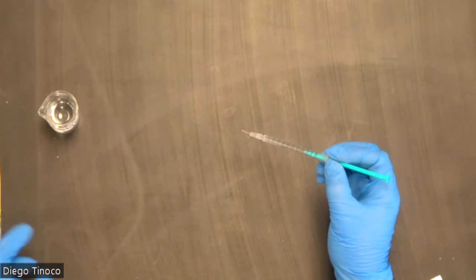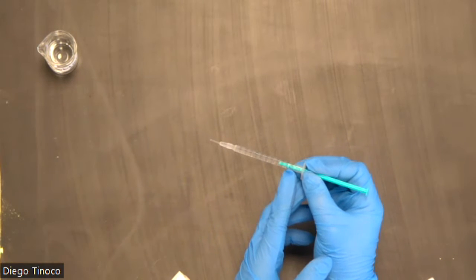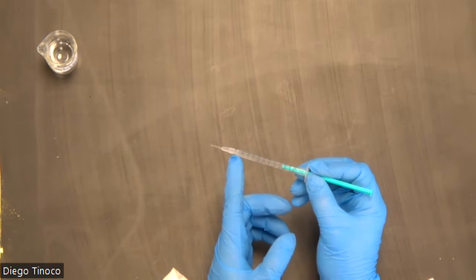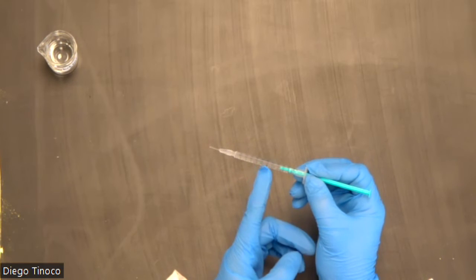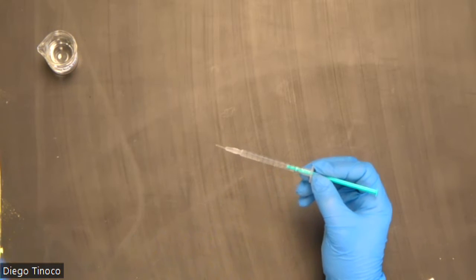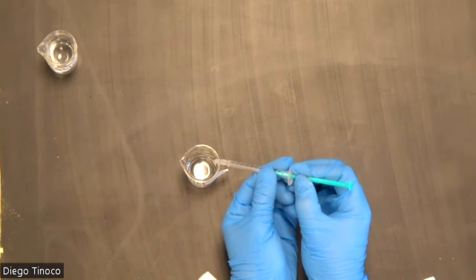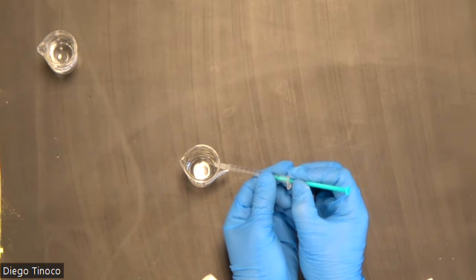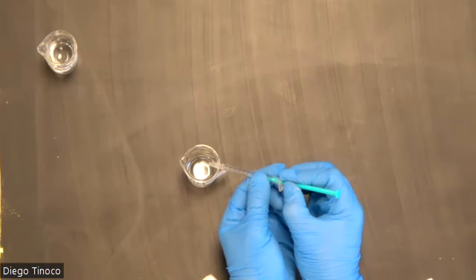You want to make sure that in your lab notebook, you write down the initial volume of your micro burette and your final, whether you use it all up or how much you use. If you only use half, then you want to get the most accurate reading that you can from your micro burette. In this experiment, we will titrate drop by drop, like so. One drop, we will mix our solution, and if we need to, make another drop.